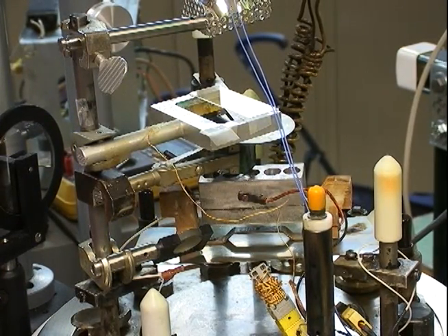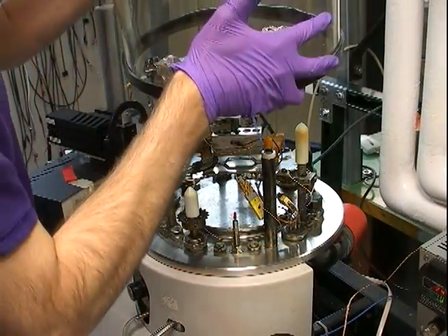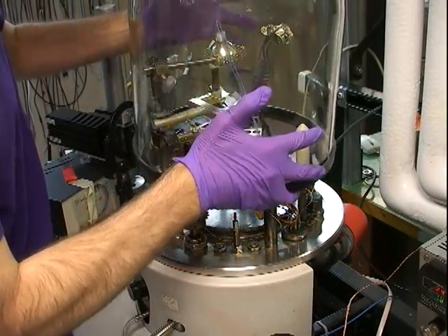It is placed on top, making sure that it is directly over the vapor guide in the hole with the sample in it. Then the bell jar is placed on top so the pressure can begin to be lowered.